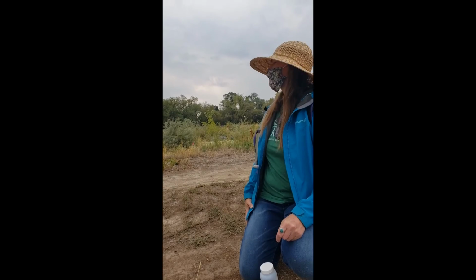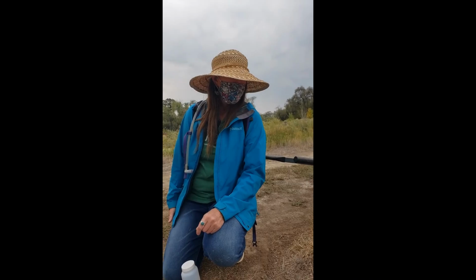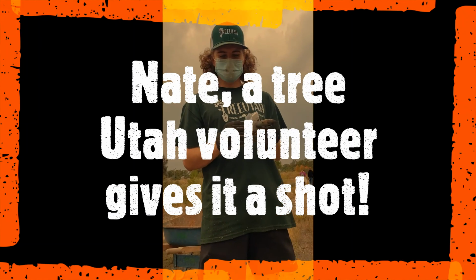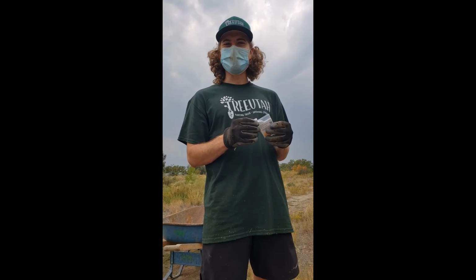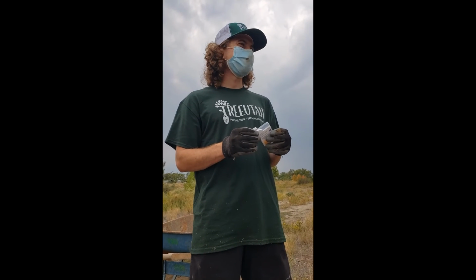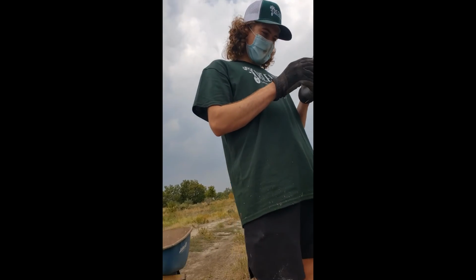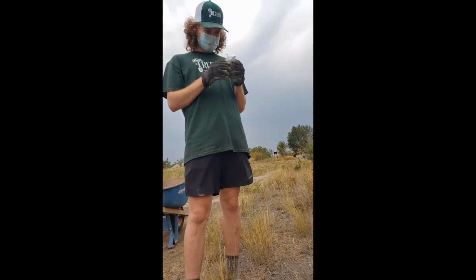What else do you want to know? I am curious about the phosphates as well. Yes, we'll do the phosphate test. You were curious about? I'm curious about the pH of the water. What's your hypothesis? I think the water is going to be a little acidic, maybe. I can't tell you why I think that, but that's my hypothesis. Good old educated guess. So what are you holding right now? I think I'm holding the pH strips. Yep.